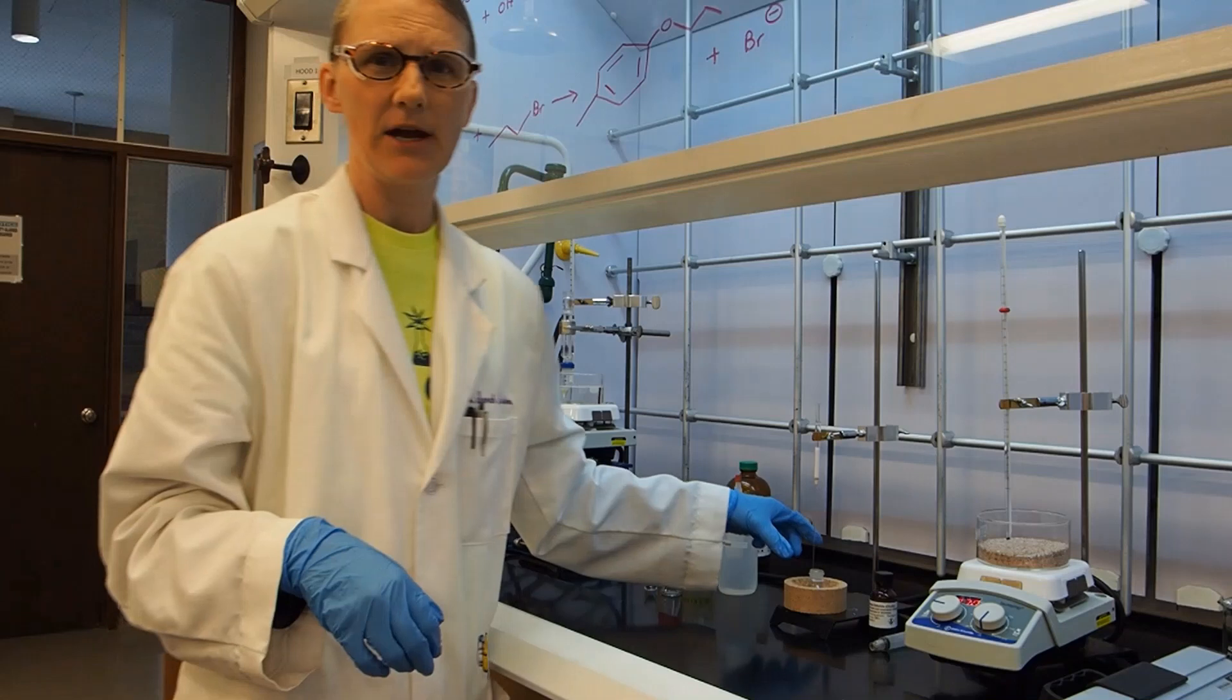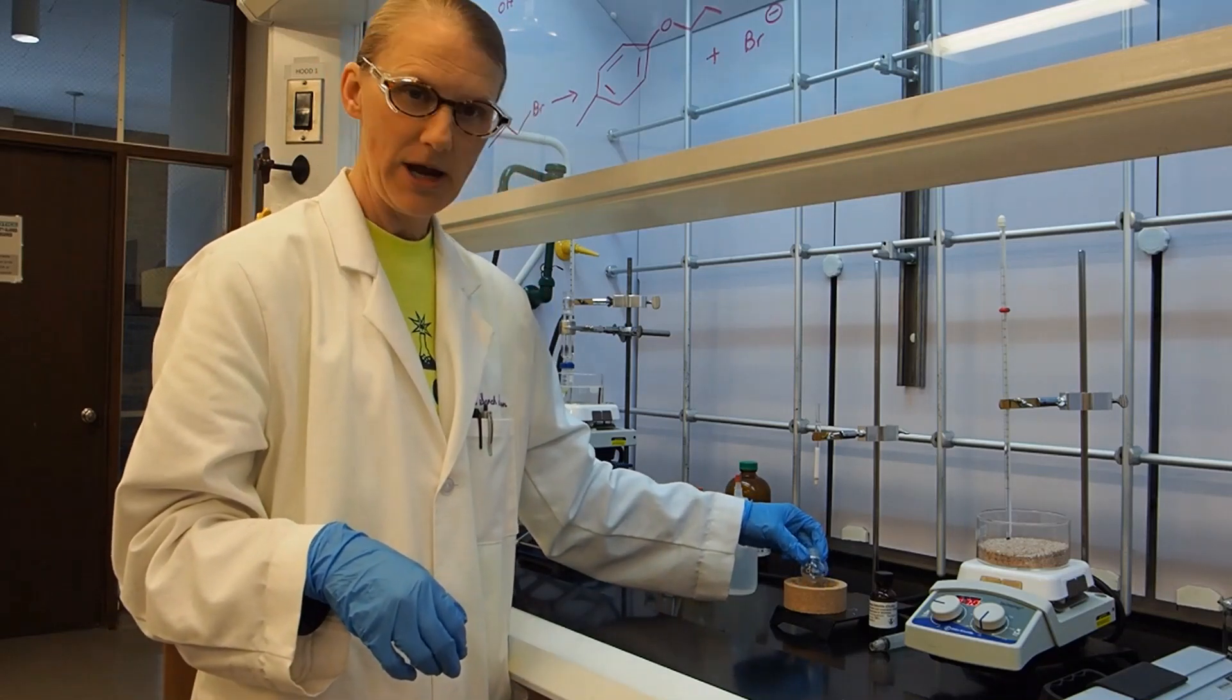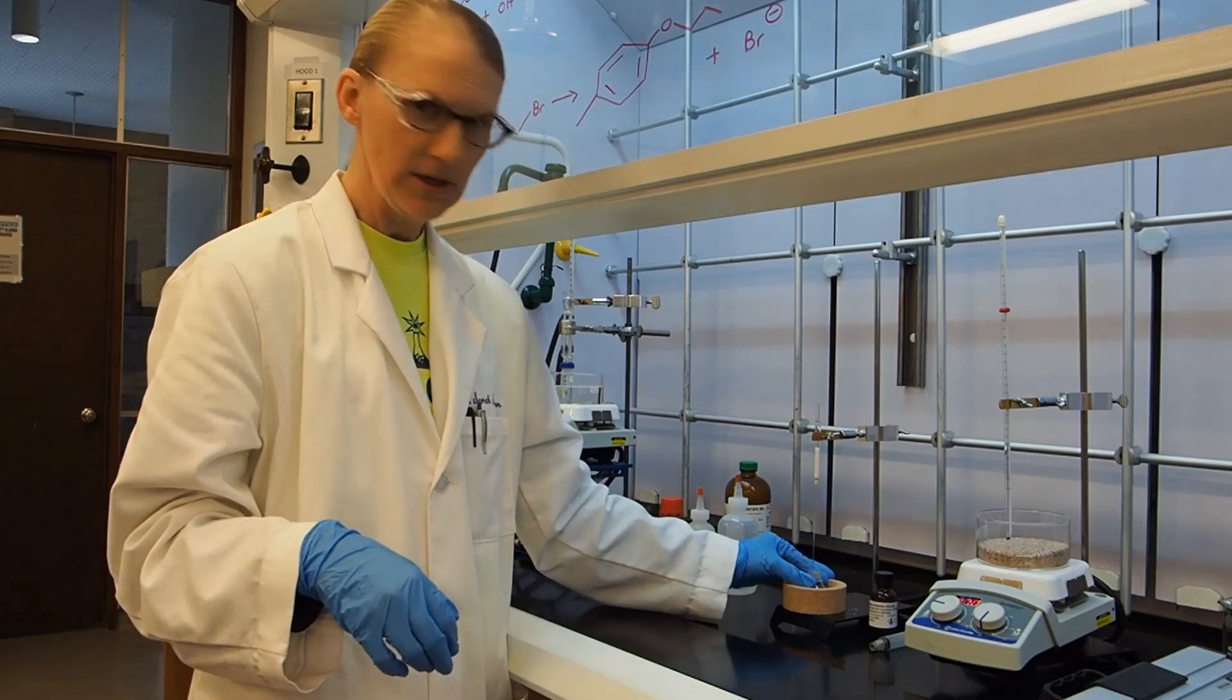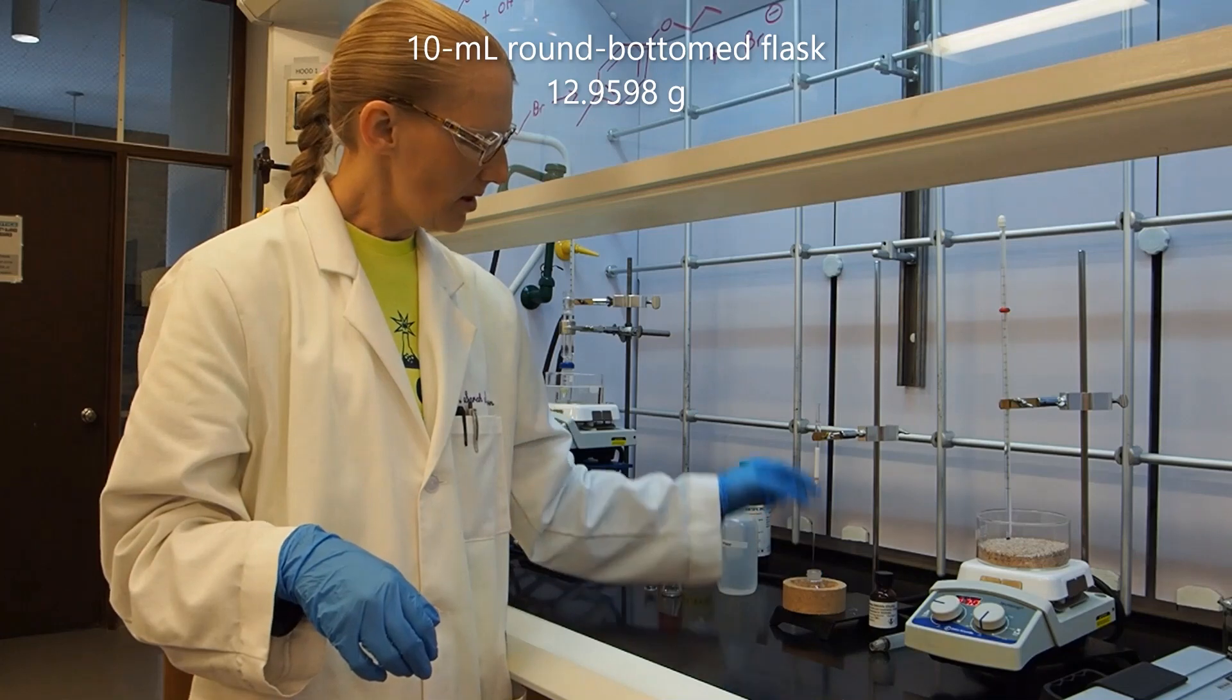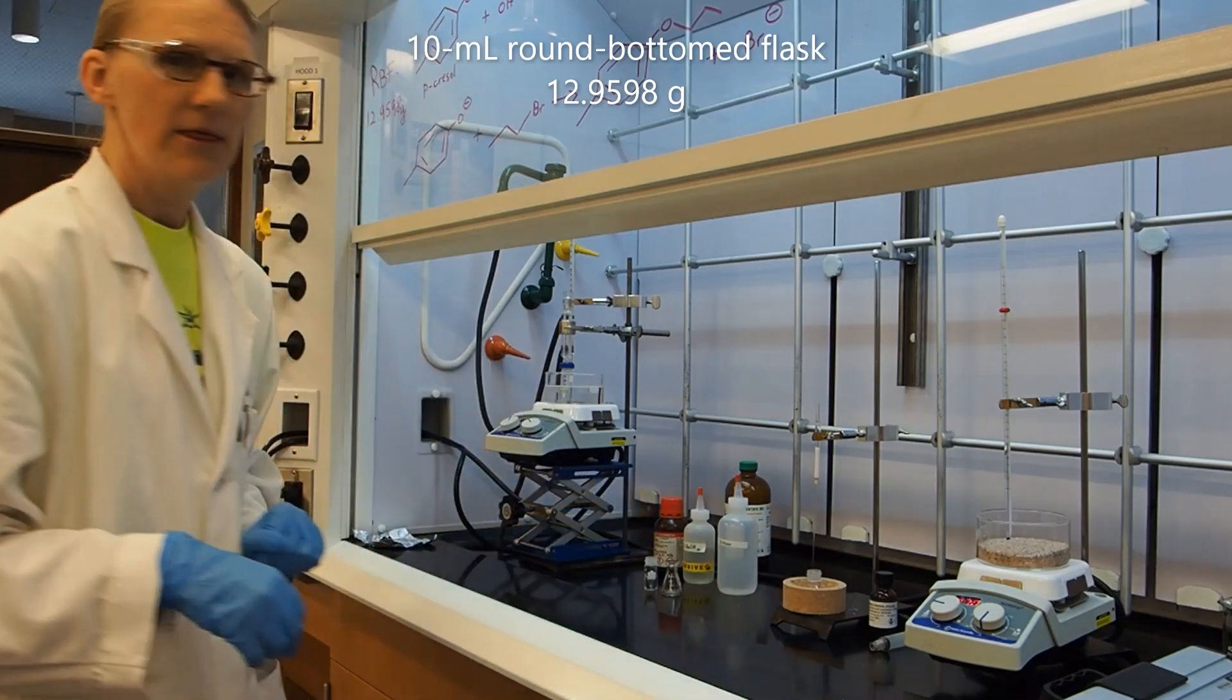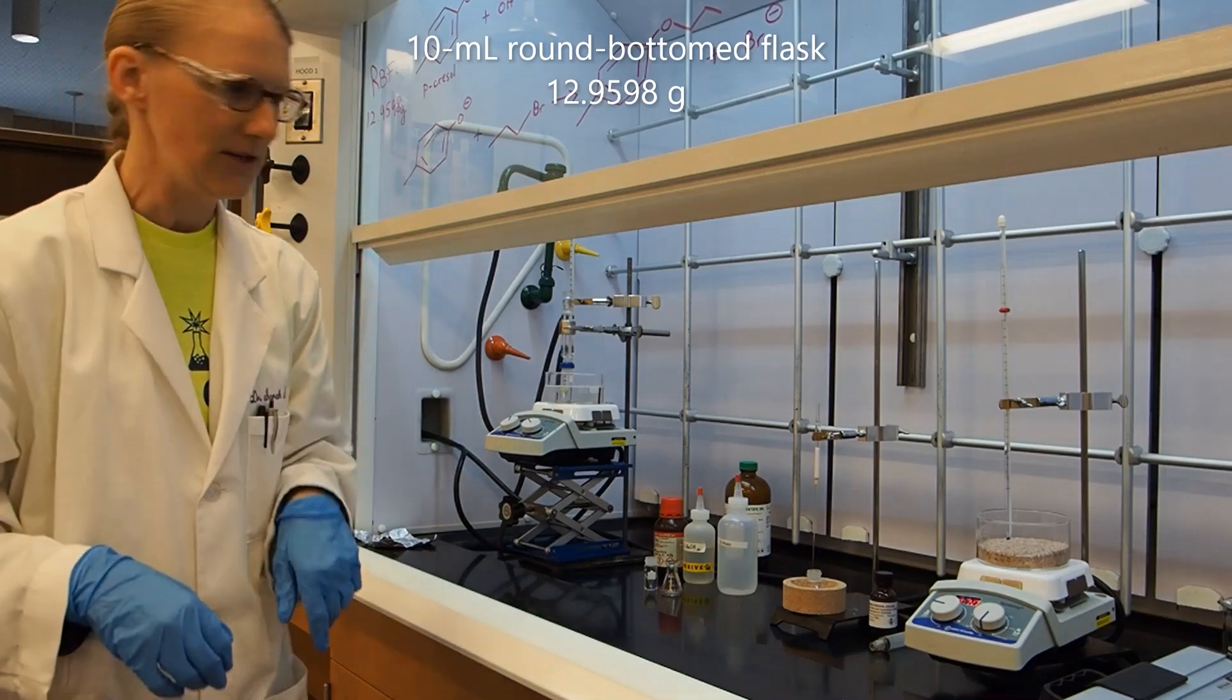The other thing that I have prepared ahead of time while the reaction is running is I have weighed this 10 mL round bottom flask that will be capturing our eluent for the column. The weight of it is 12.9598 grams.